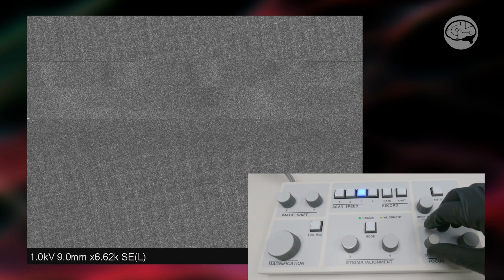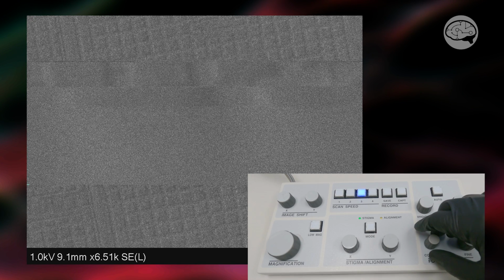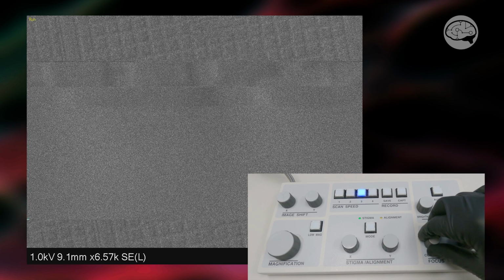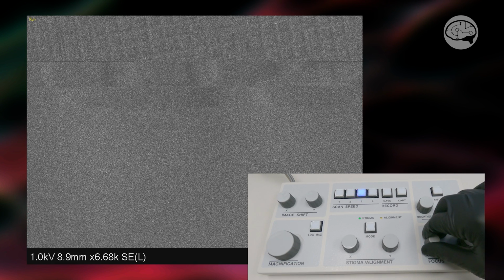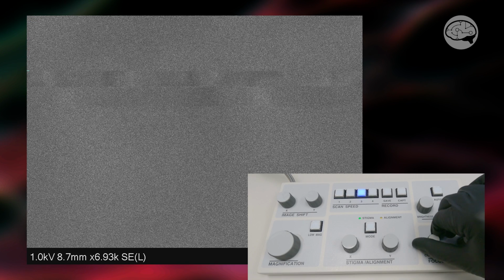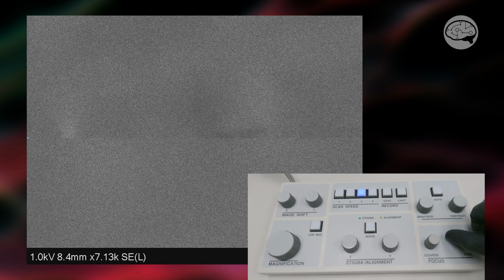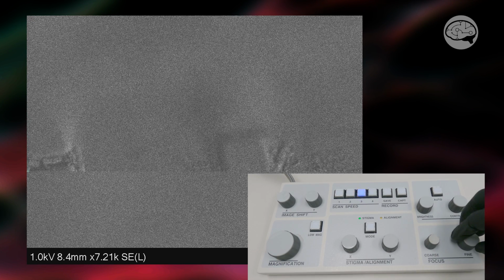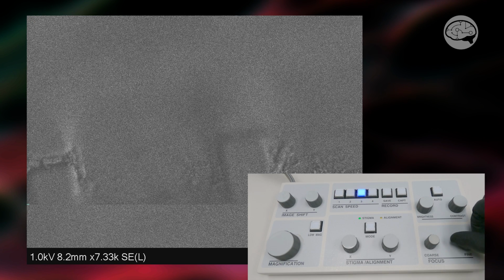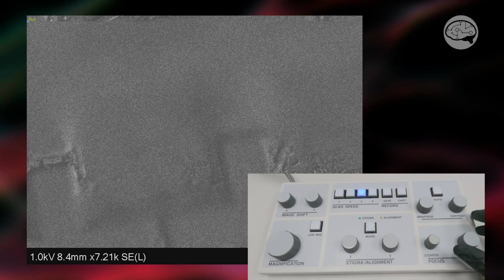So we'll start here at around 9 millimeters, and I'll focus it back up towards the lens to where I think the sample should be. And I'm using the coarse focus knob right now, but at this higher mag, I think that's probably a little too much. So I'm going to use the fine focus knob instead. And there was our sample already. We found it right there. So this technique is really, really helpful.